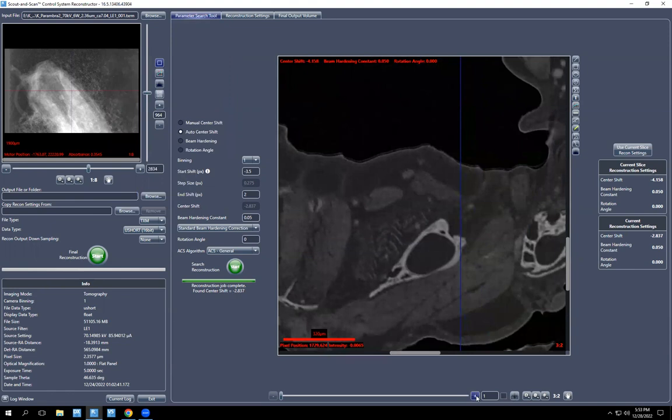And then click through different values and you see it become better and then become worse. Now it's becoming worse. So you would go back. So right now we're at -1. It's better. 2.3 is better. 2.5 is even better. So we actually missed the value that the computer found. But the best one is somewhere near that value.